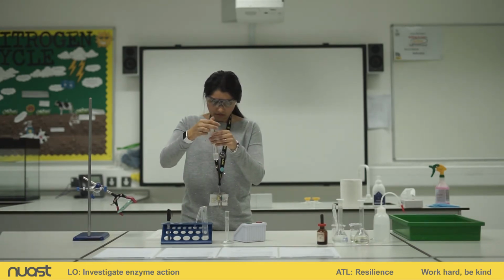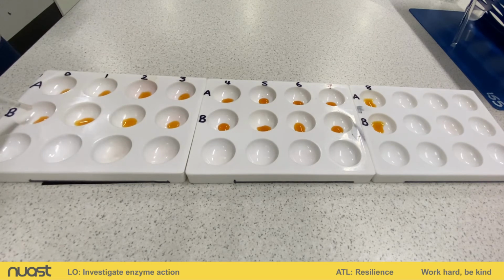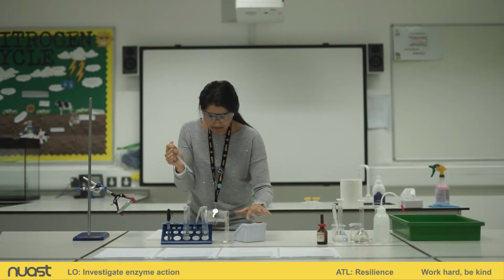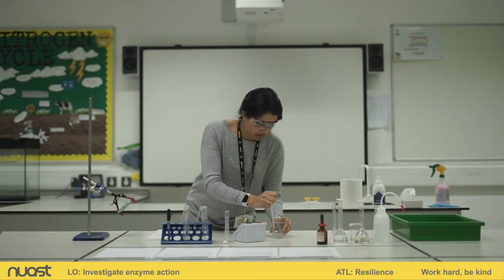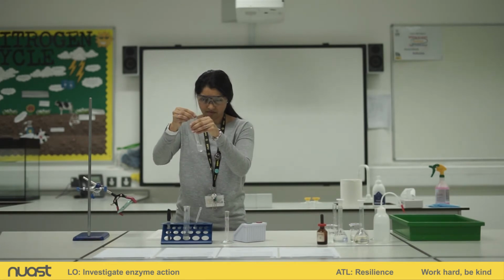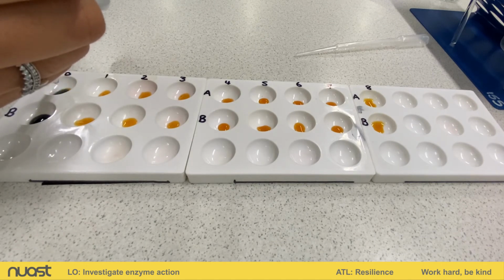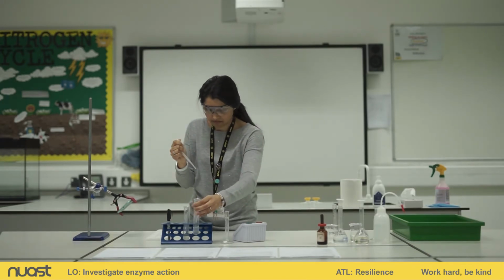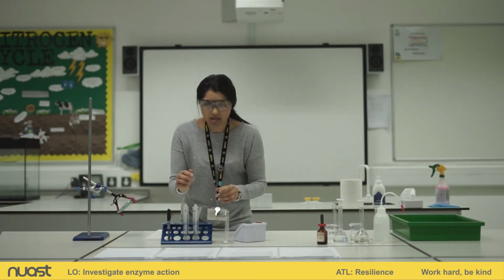Okay, 2 drops into B, start the timer. Okay, I'm also going to do that with A. And now we wait.